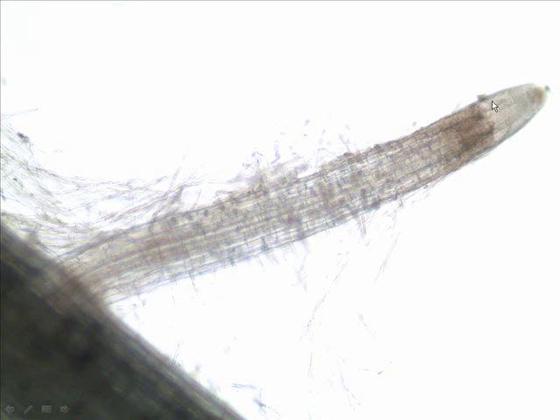We could call it a couple things. It's a particular meristem, and so which meristem? Apical meristem, the region or area of cell division. Behind the apical meristem, there is another region or area. What? The area of what? Cell elongation. And then we've got a root hair zone starting here, and in fact, that might even be a little branch root growing out of the main root. And so we have even branch roots developing on the branch root. Yes, lots of branch roots developing.